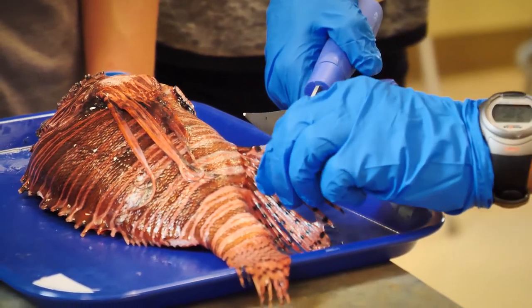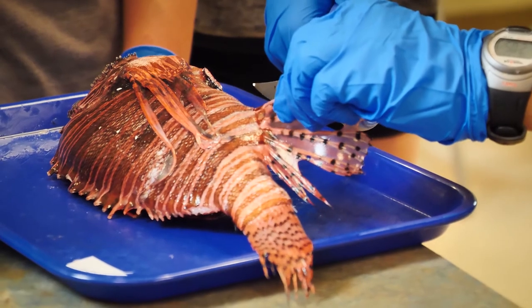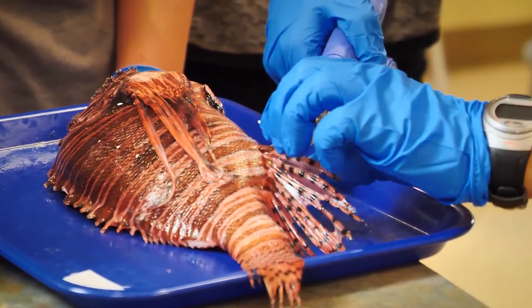I'm here to help establish data for a citizen science project using DNA barcoding to figure out what the lionfish's last meal is. Here at the Conservancy, the kids will receive whole lionfish and use tools to dissect the fish and quantify how many prey items are in each of the lionfishes.